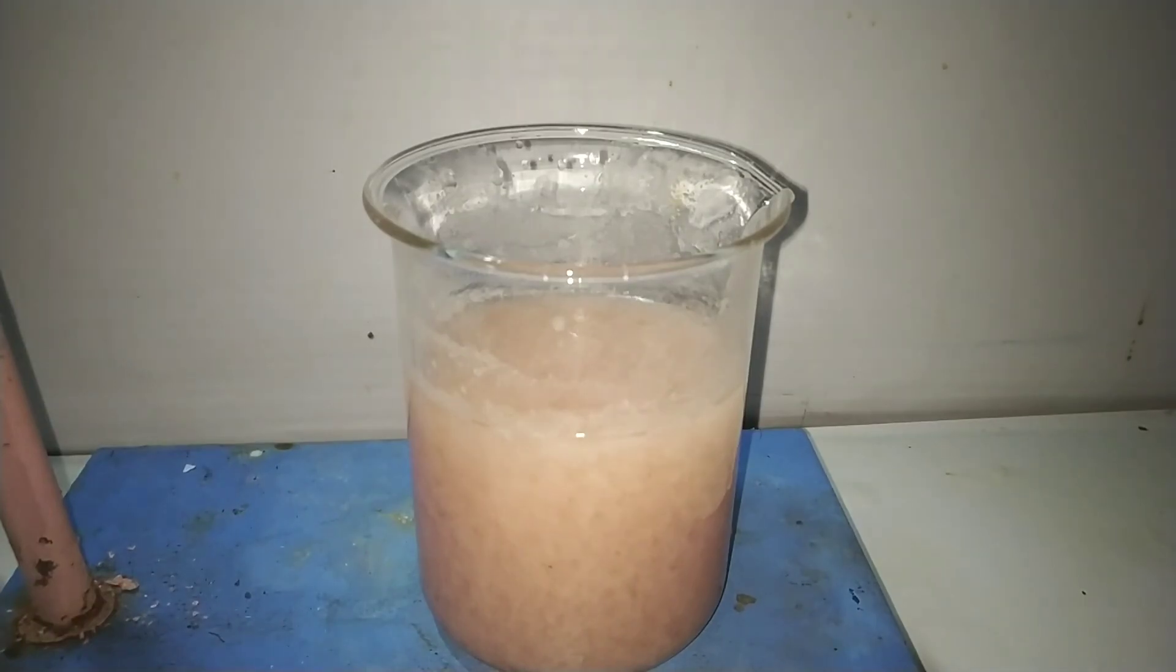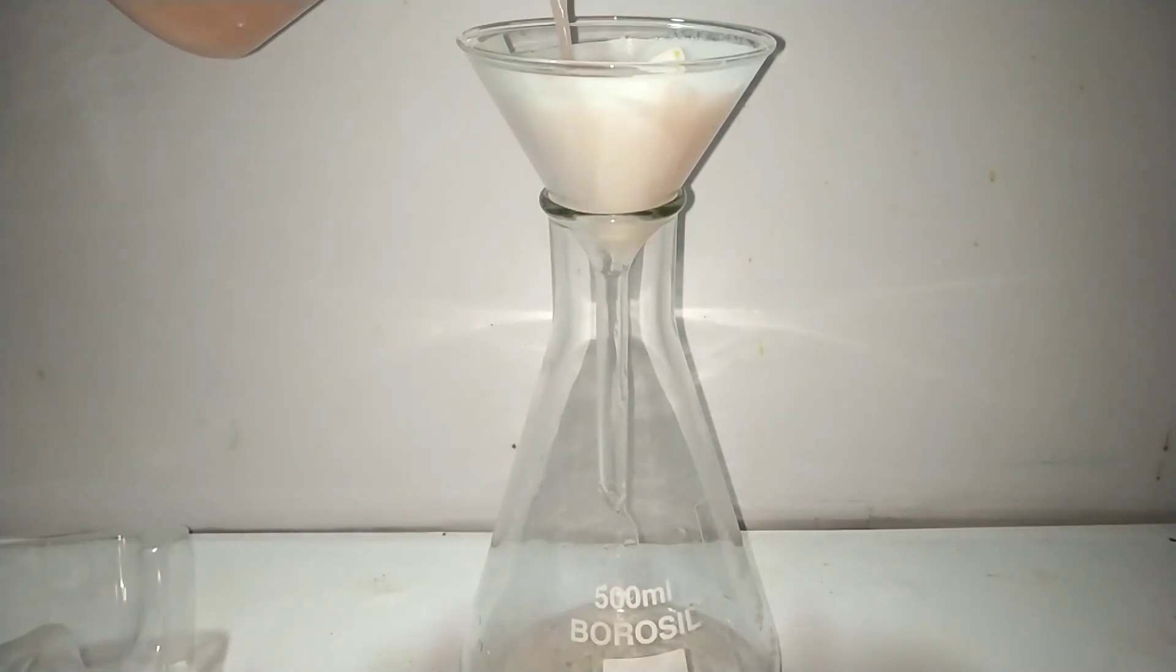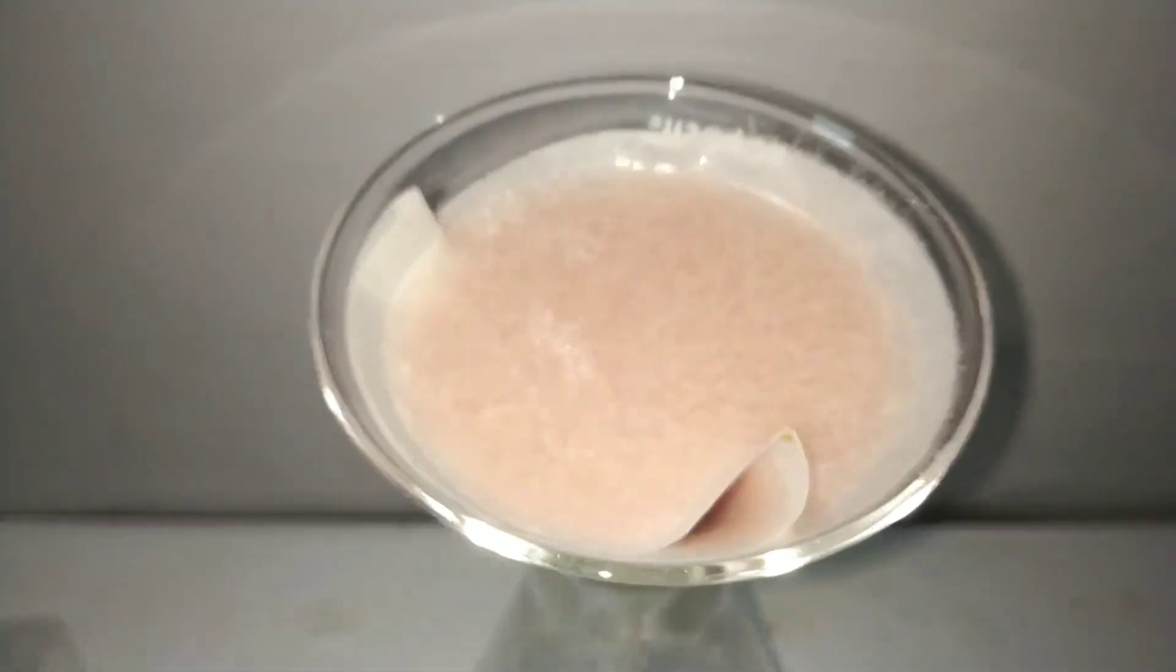This was then filtered by simple gravity filtration method. After filtration a light red tinge remained. So I washed the compound a couple of times with cold distilled water.